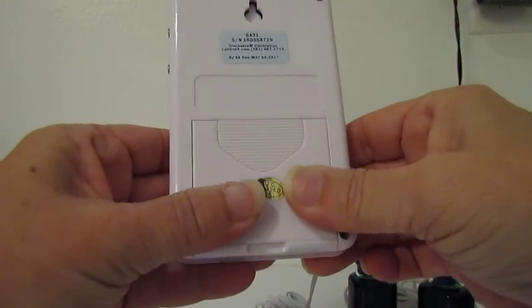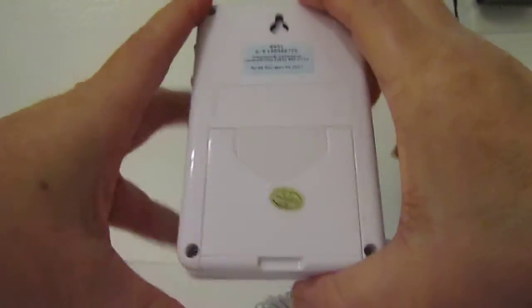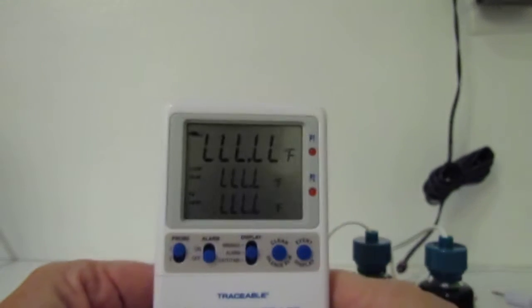I apologize if I'm getting out of the screen here because I'm trying to do this myself. Replace the back and then your unit will come on.